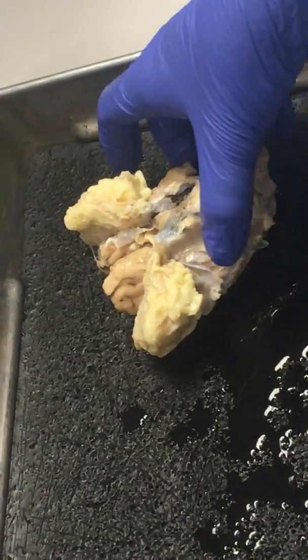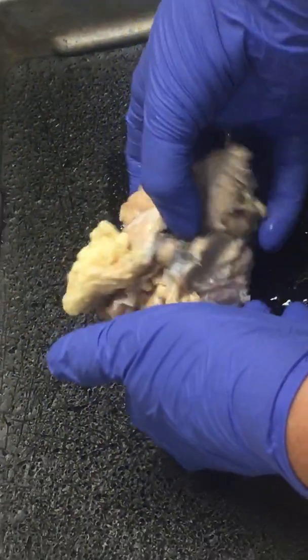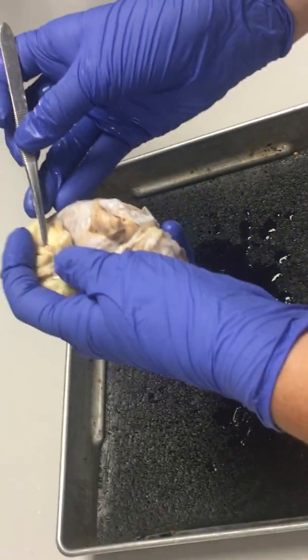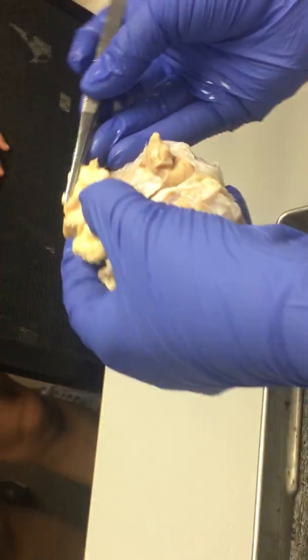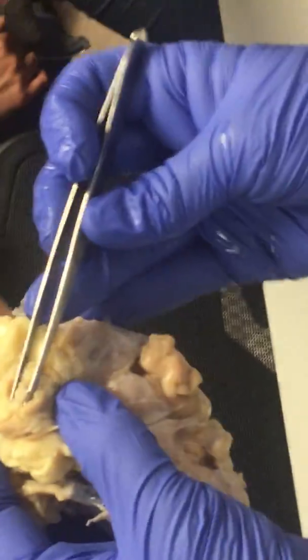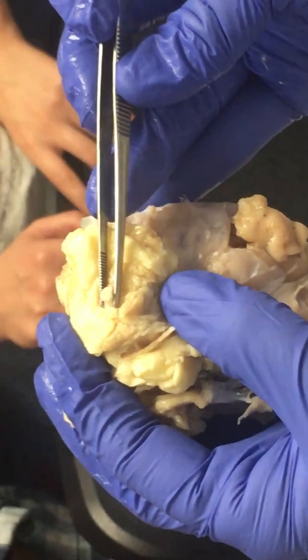What we're going to do first is look at just the exterior structure. Since we have this whole thing, this is the optic nerve right there — it's got a little circle right there. So, that's the optic nerve.